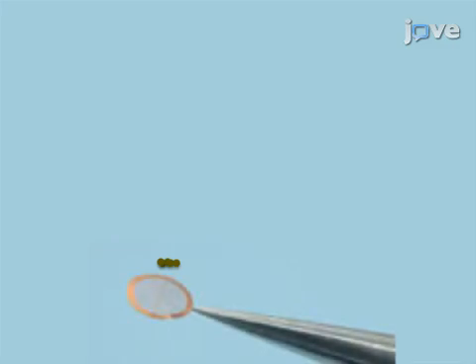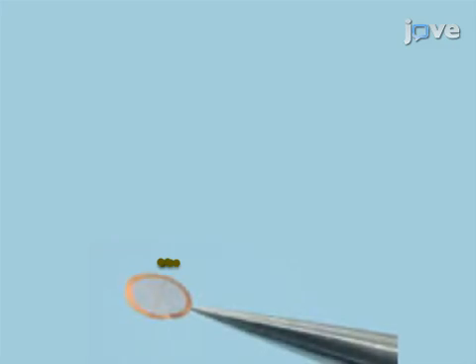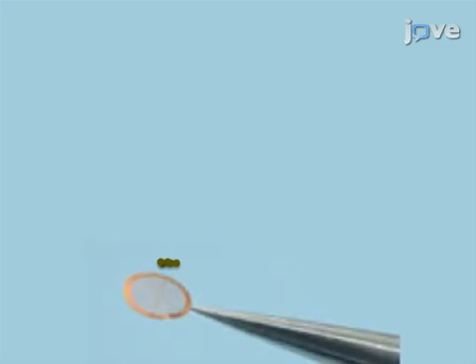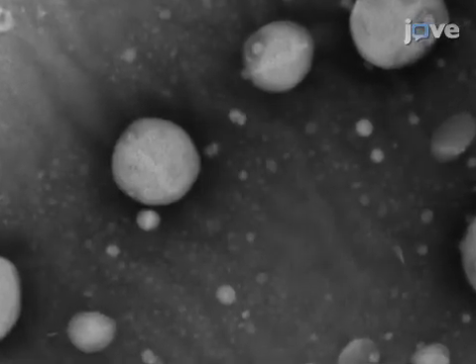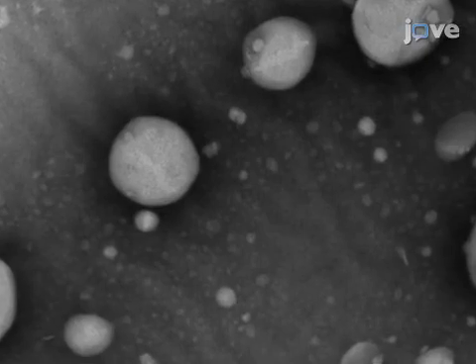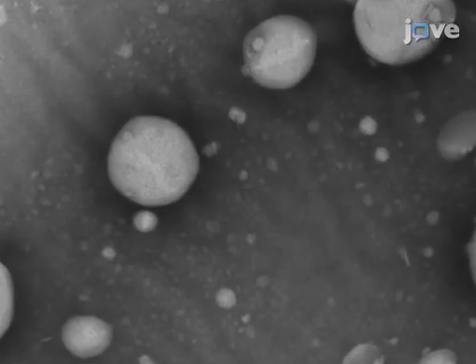Finally, the isolated lipoproteins are negatively stained with phosphotungstic acid. Ultimately, particle size analysis is used to show the relative abundance of chylomicrons to very low-density lipoproteins.